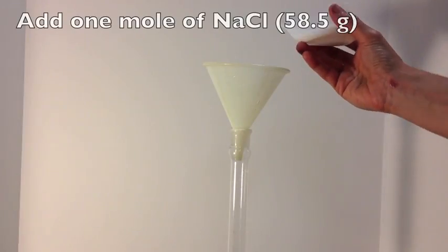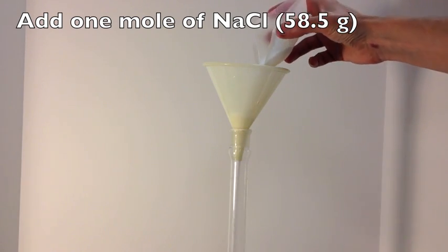Now add your one mole. If we were making a two molar solution, we'd have two moles. But here we're just adding one mole.